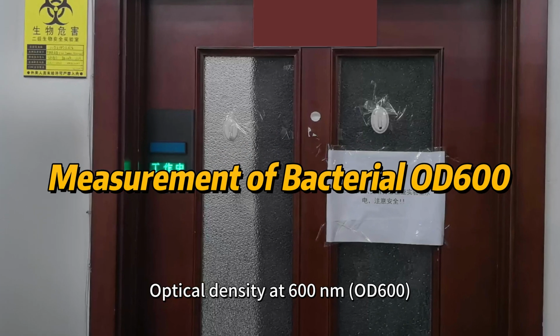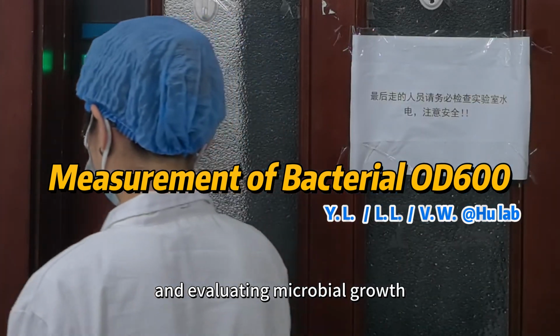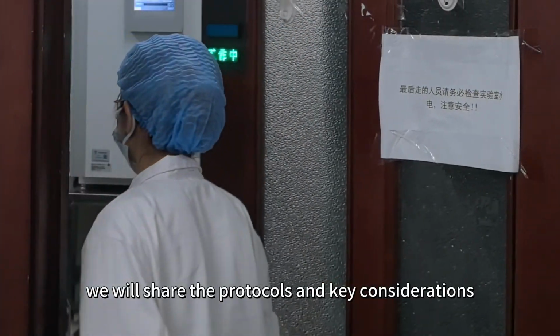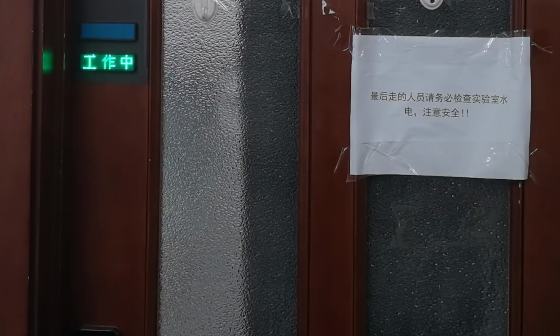Optical density at 600 nanometers is a critical parameter for quantifying cell density and evaluating microbial growth. Today, we will share the protocols and key considerations for accurately measuring bacterial OD600.